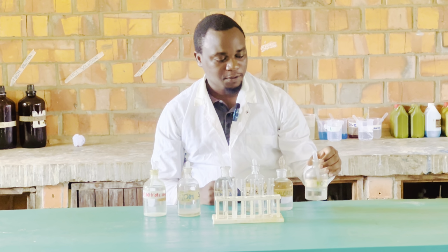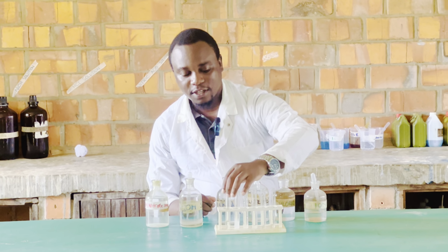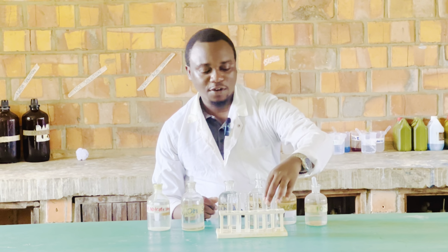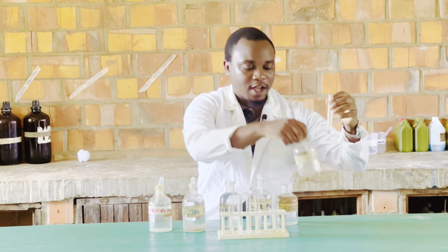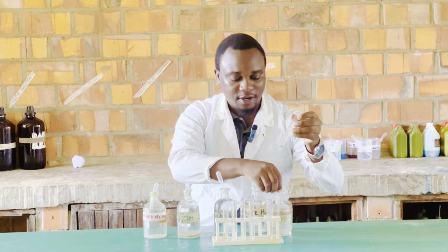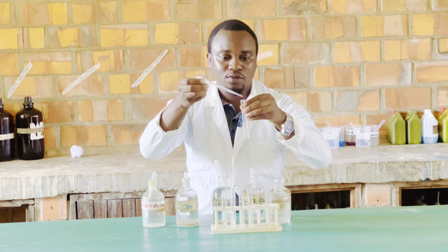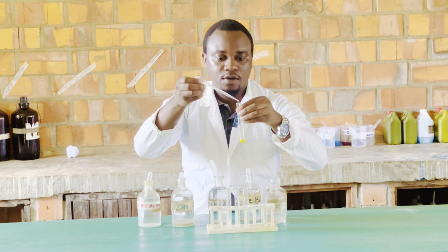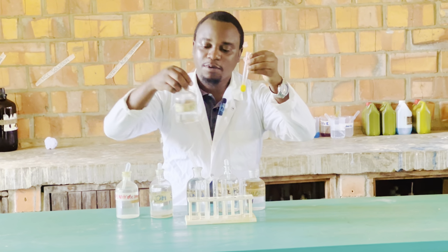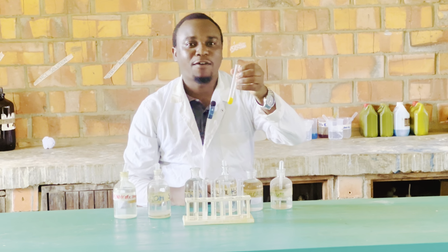Lastly, all these test tubes, all the observations we have seen, confirm to us that we are dealing with lead ions. However, we have one which we can take as the confirmatory test. That is when we add potassium iodide solution. Let's observe what happens when we add potassium iodide solution to a solution containing lead ions. So we shall add just 2 to 3 drops. Oh, we can see we are forming a yellow precipitate. So on addition of potassium iodide, we observe a yellow precipitate, and this serves as a confirmatory test.